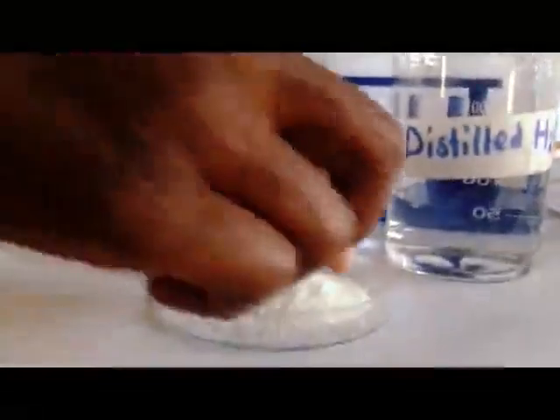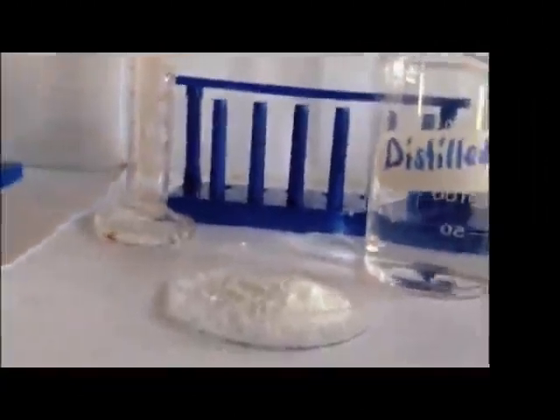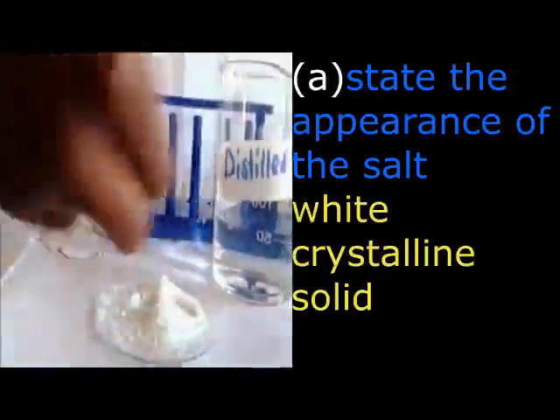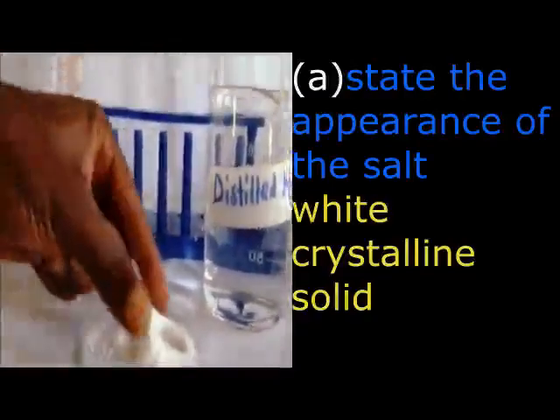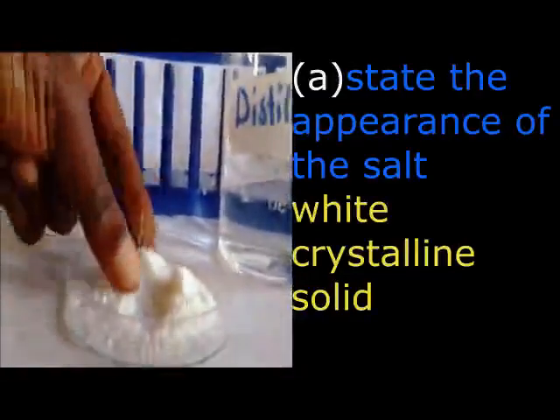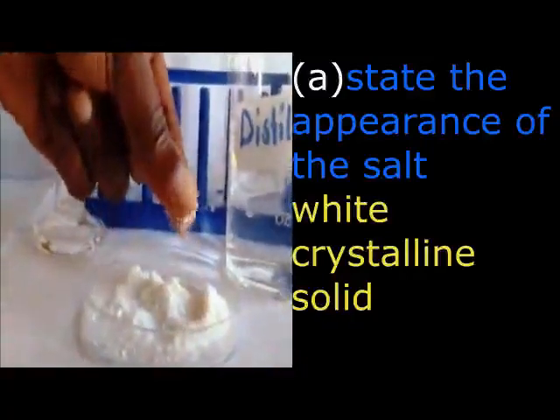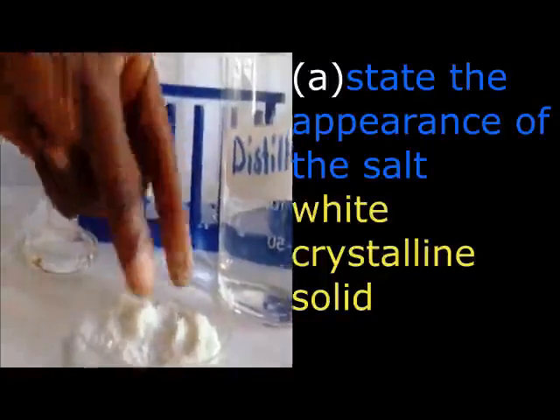So now I want you to look at our salt on the petri dish. That is the salt. Now we are going to discover that, first of all, our salt is white. Then secondly, our salt is in a solid state. Then there is one more thing you are looking for, the texture. How are you going to take it? That is by feeling the salt. So you have to feel the salt using your fingers or your skin. Now the salt which we are dealing with is crystalline.